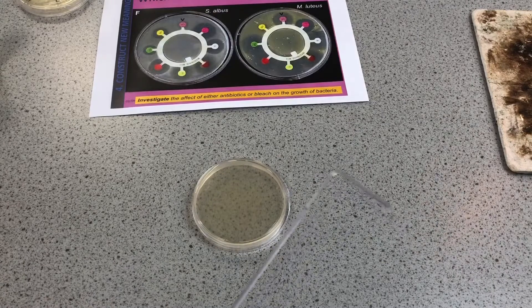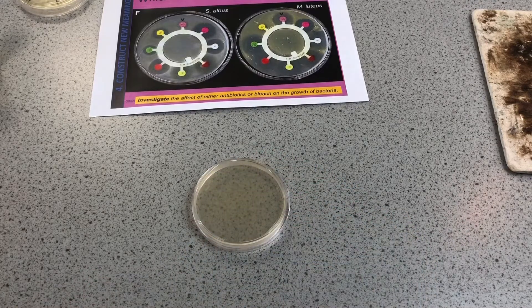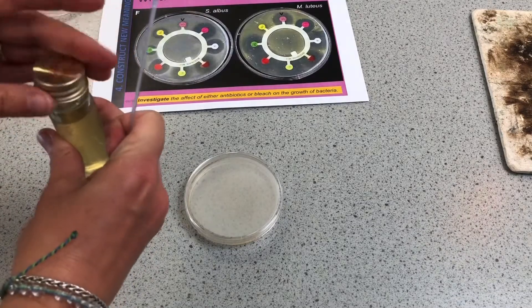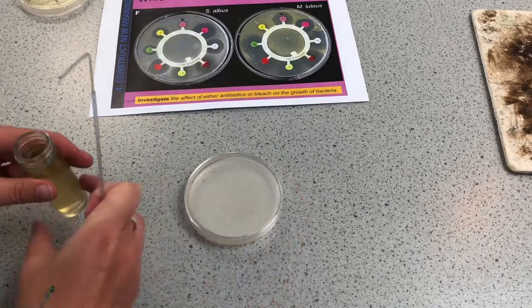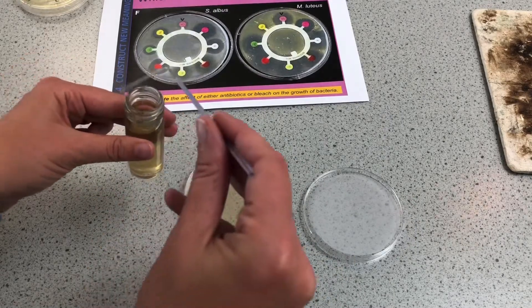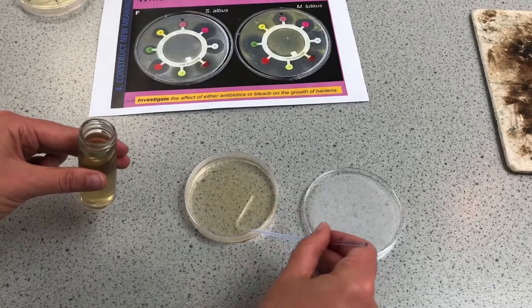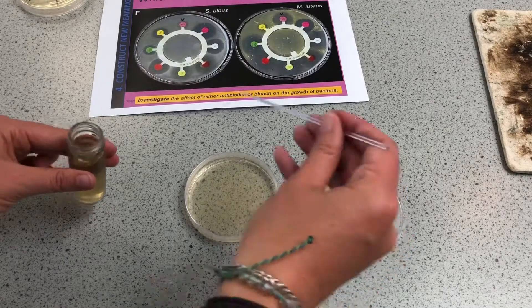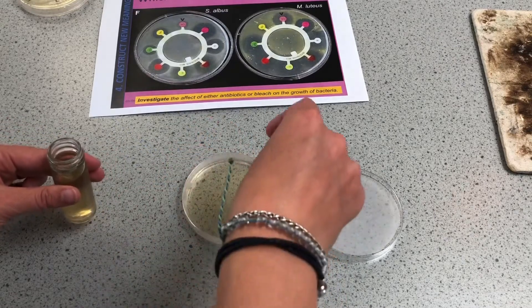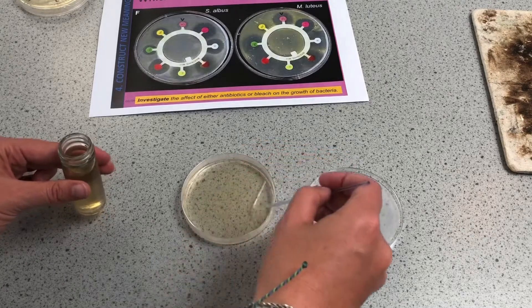This time I'm going to show you one of these sterile scrapers. It creates what we call a lawn — like creating a lawn of bacteria over the plate. I'll turn the plate the correct way up, use my E.coli again, hold the lid in my fingers, and just put that into the E.coli and scrape across to get good coverage without piercing the jelly.